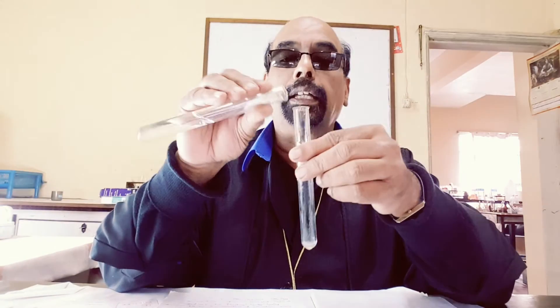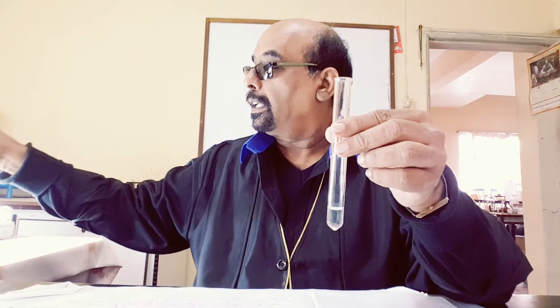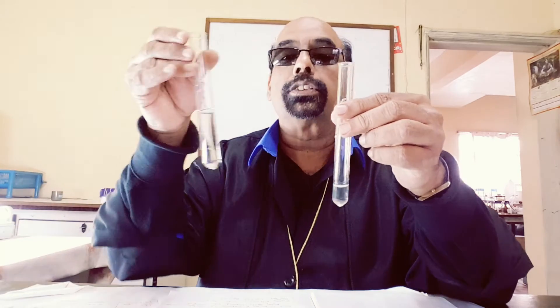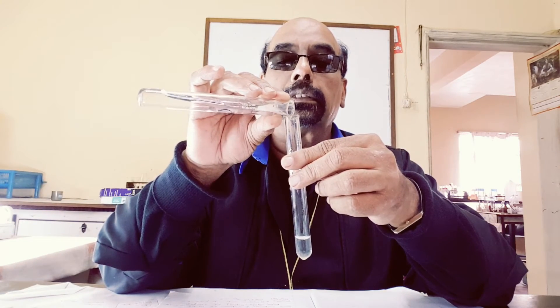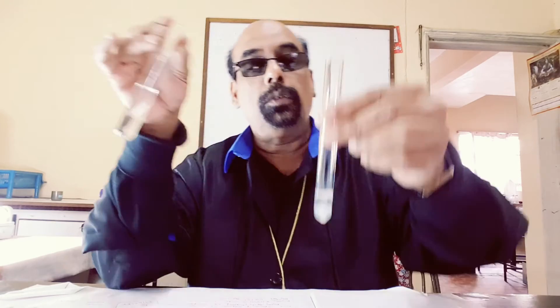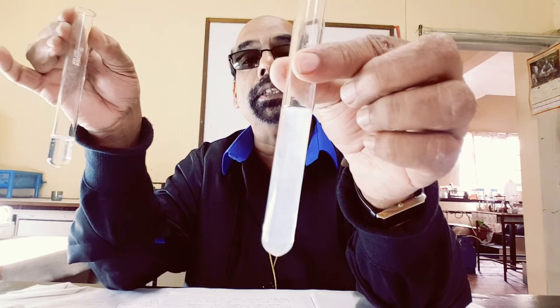I have here a tube containing the magnesium solution. I take a small amount of the magnesium solution and add sodium hydroxide solution, then observe. A white precipitate is formed. If I add more sodium hydroxide, the precipitate will not dissolve — it is insoluble in excess.